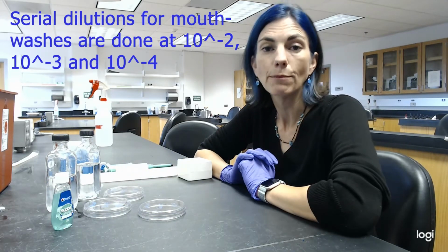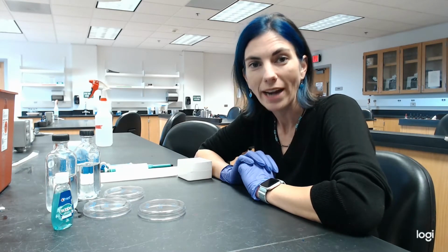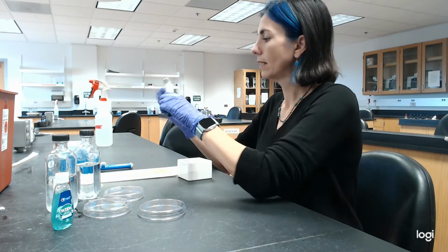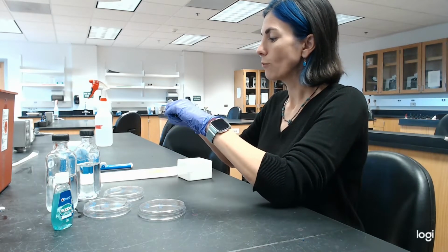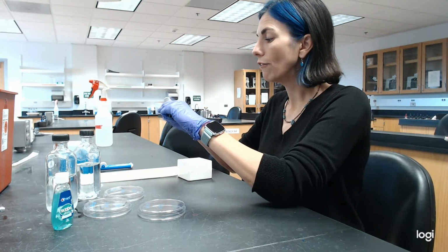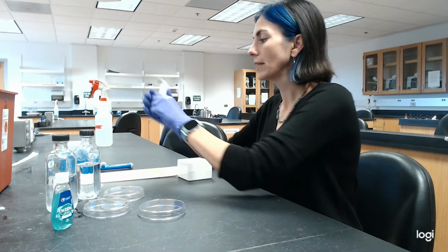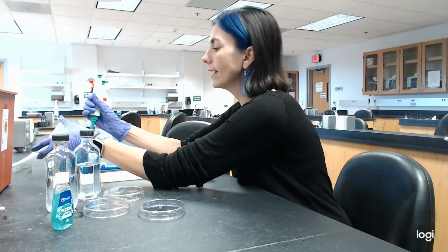So notice that I'm skipping 10 to the minus 5, minus 6, and minus 7 because I don't expect those to have colony numbers between 30 and 300. All right, so let me get started. I'm going to start by taking a half a ml of scope and mixing it with my saliva and then letting it sit for 30 seconds.